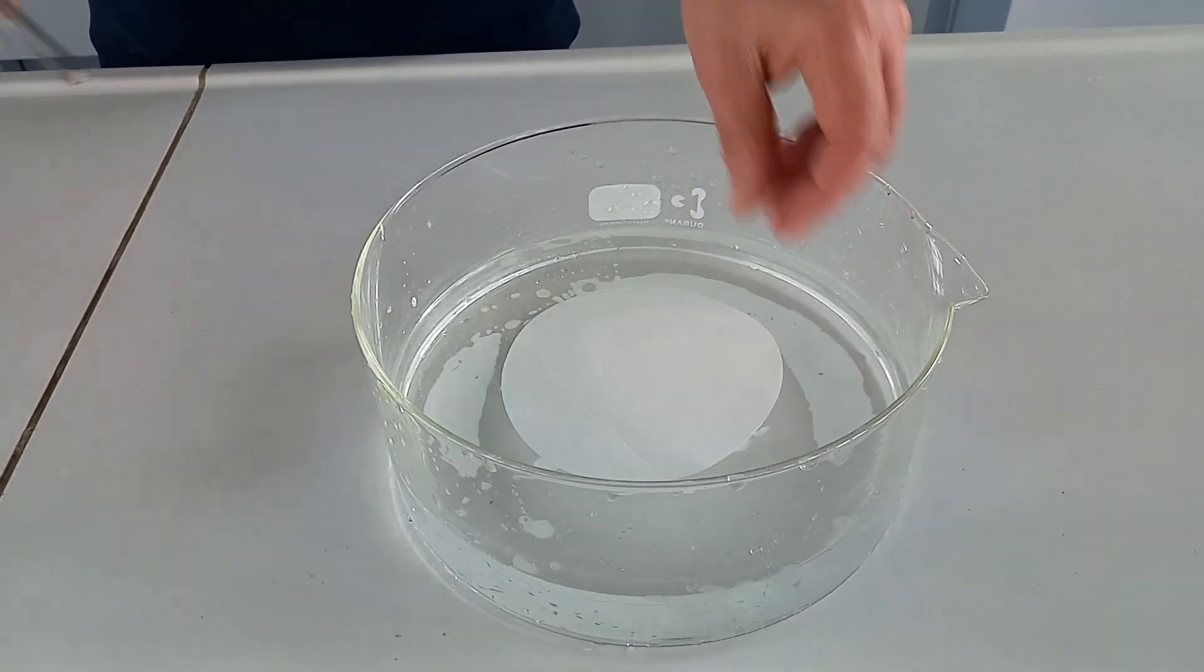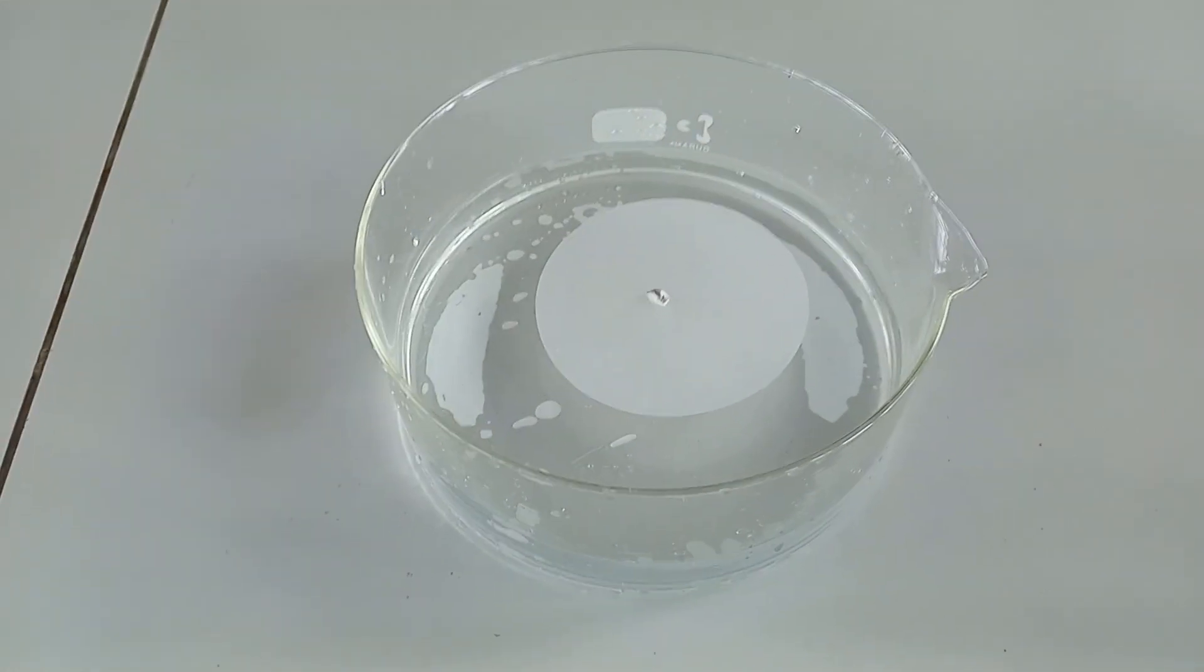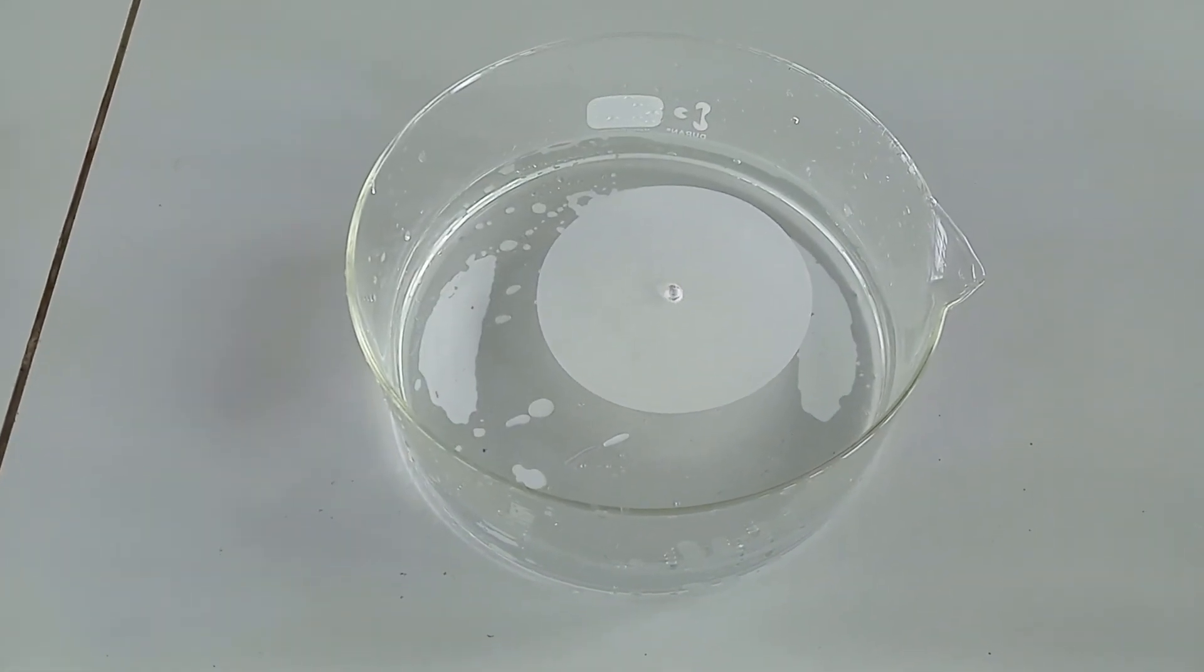After you've just seen how the sodium reacted with the water and just got smaller and smaller, let's take a different approach for the sodium this time.